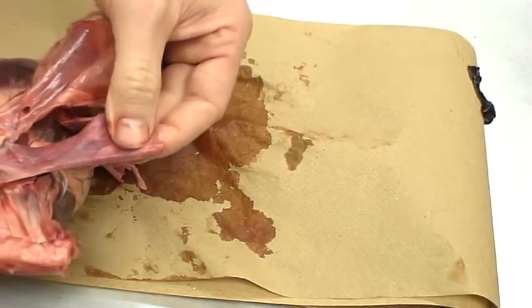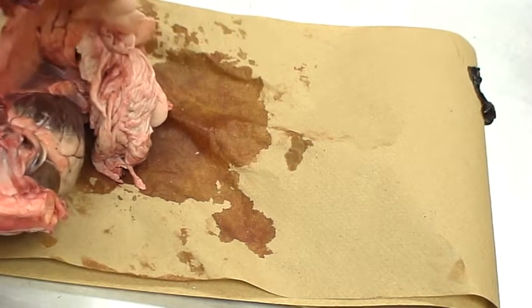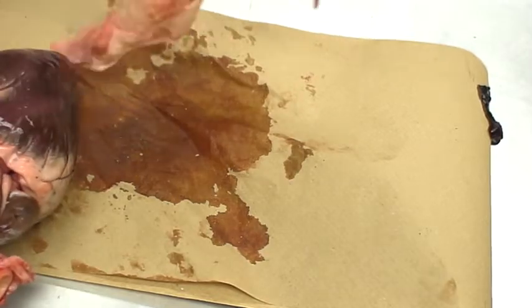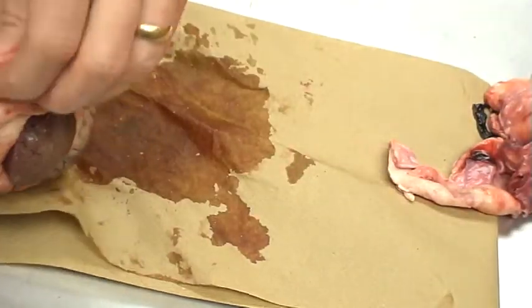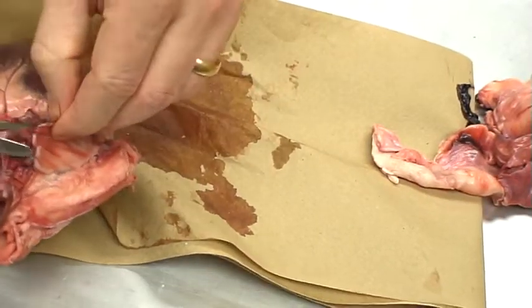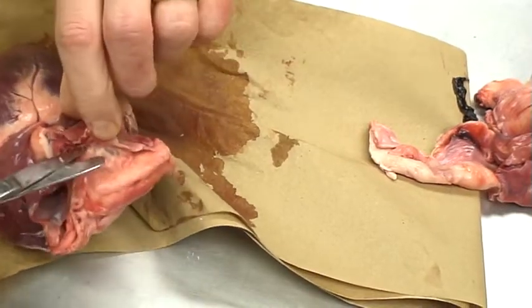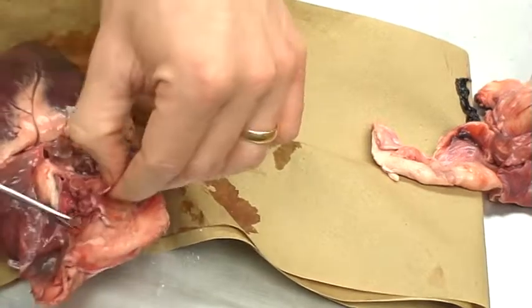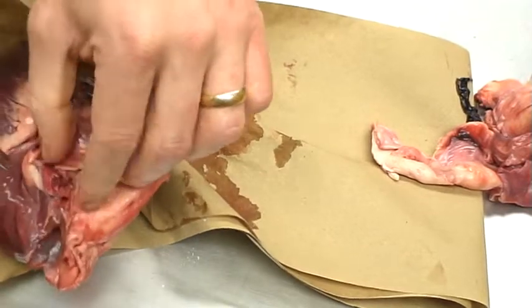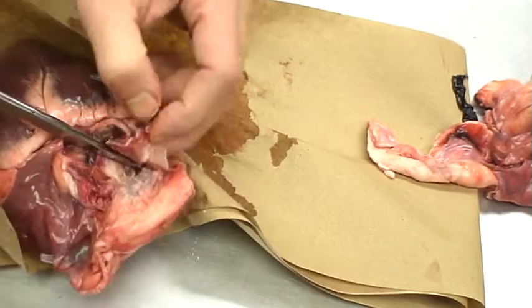A little bit of a thymus gland that's still on the heart. And actually a little bit of trachea. Good job in harvesting this and saving everything. The trachea obviously is going to be leading to the lungs. That's going to be closely tied to the membrane itself. In fact, it's held together by the ligamentum arteriosum, something that holds all these tubes together so they don't get twisted up.